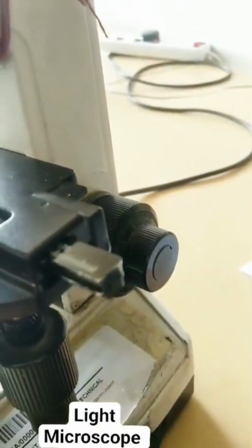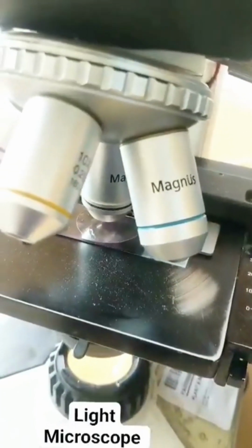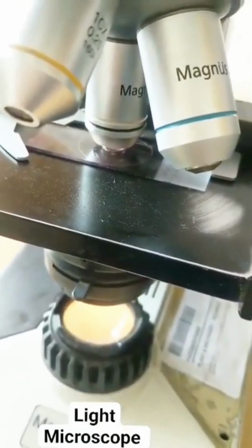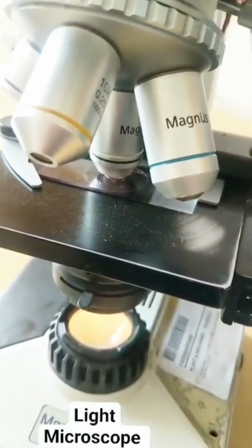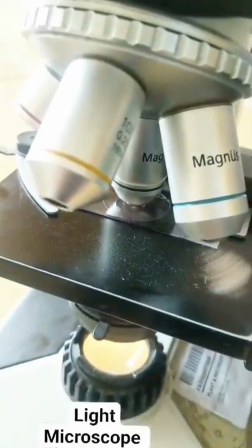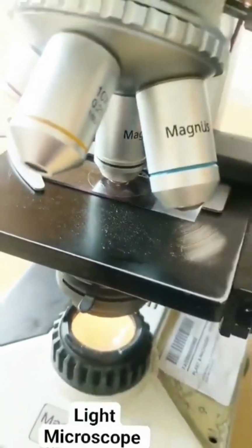So what is the big knob? See, when I move the big knob, the stage is moving. Do you notice now the oil and the slide have come in contact with the lens? The big knob is the coarse adjustment. But now I want to adjust it as per my vision, so I will move this tiny knob over here. When I move this tiny knob, you can hardly appreciate that movement because this is just to adjust it as per your sight.